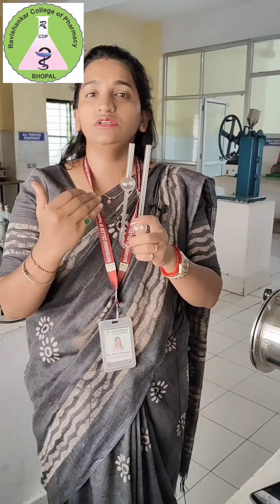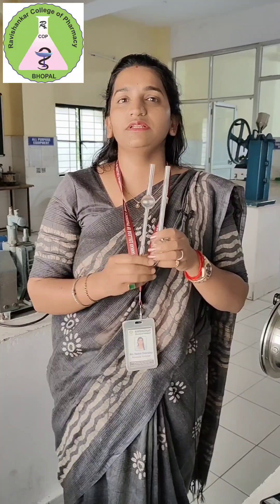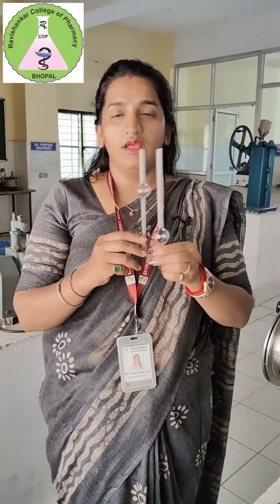In the same procedure, we take the same sample and then use a reference sample that is most commonly used — water. Because we know the density and viscosity of water, the same procedure will be followed for the water.